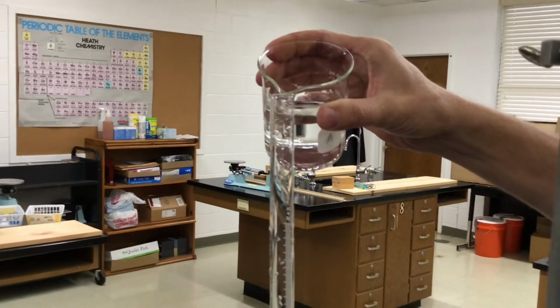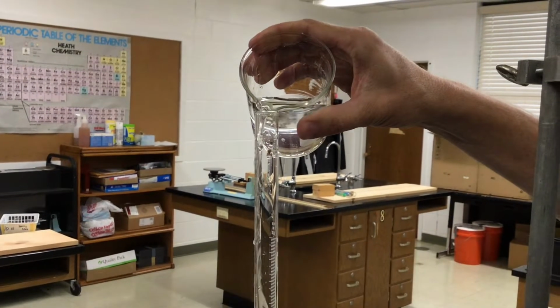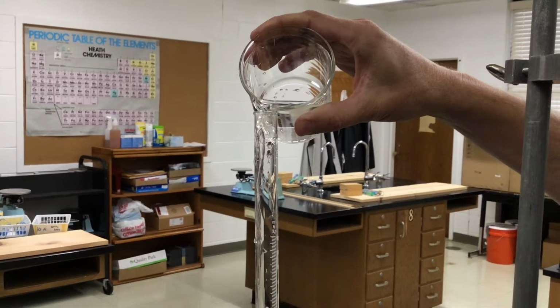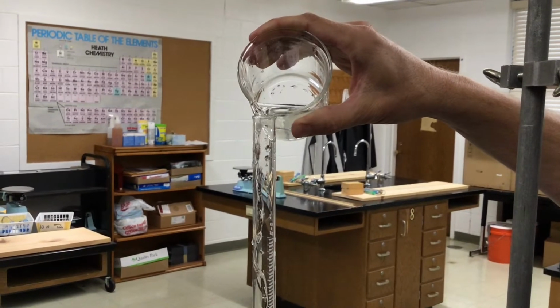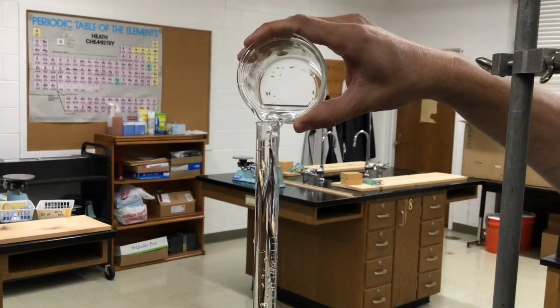Can you see it, everybody? Lainey, can you see it? I think so. Okay, here we go. I'm going to pour water. Okay, what do you see about the edge? Little wavy lines. That's the gas leaving. The different gas has a different density, so it's a different index of refraction. Looks like heat waves. It's not heat waves, it's the index of refraction of a gas. So I just let the butane go out.